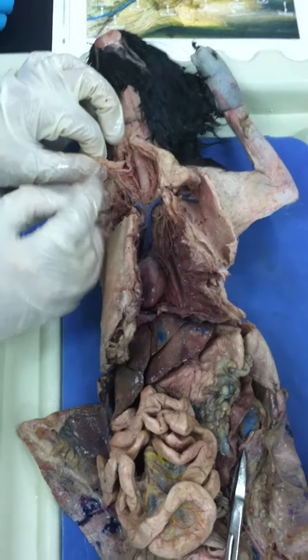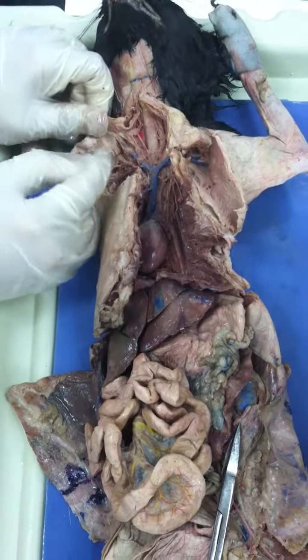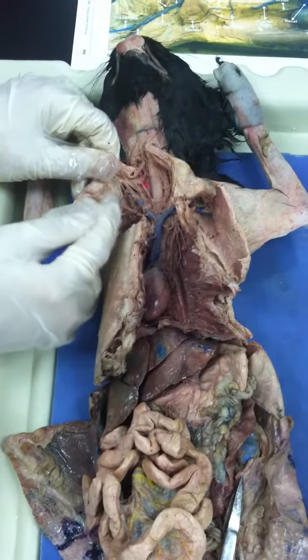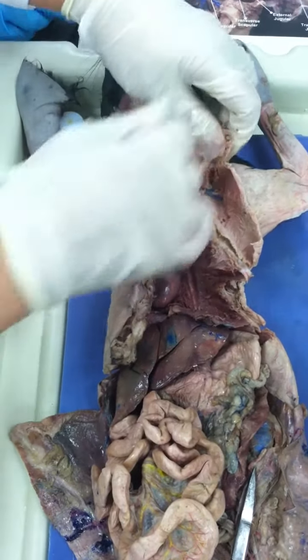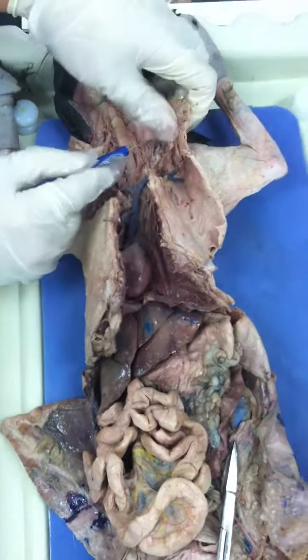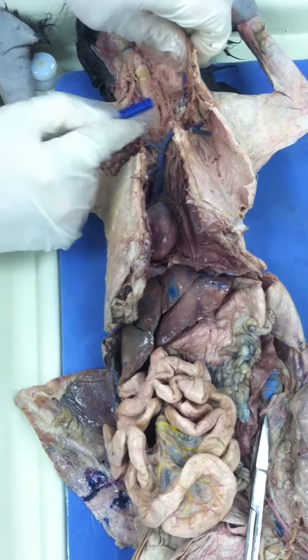And then we'll see how this blood vessel goes in the neck, right? So what do we call it then? Jugular. Which one? External. External jugular. So what you see here is my right external jugular. You see it? And then on the left side, we're going to see the left external. You see how this one goes parallel to the neck? You see how we just have to trace it and follow it all the way.